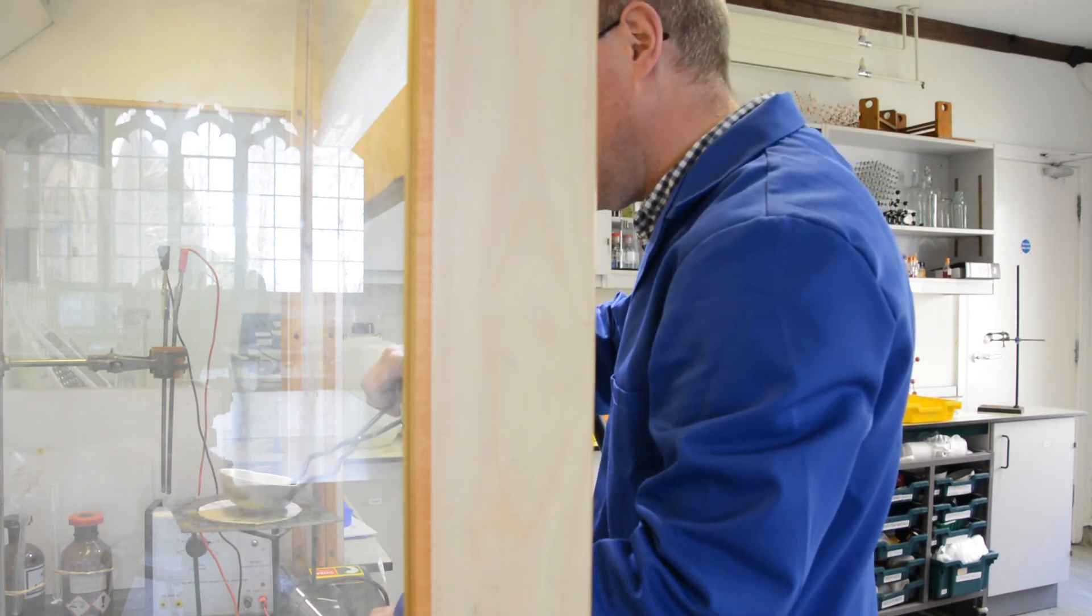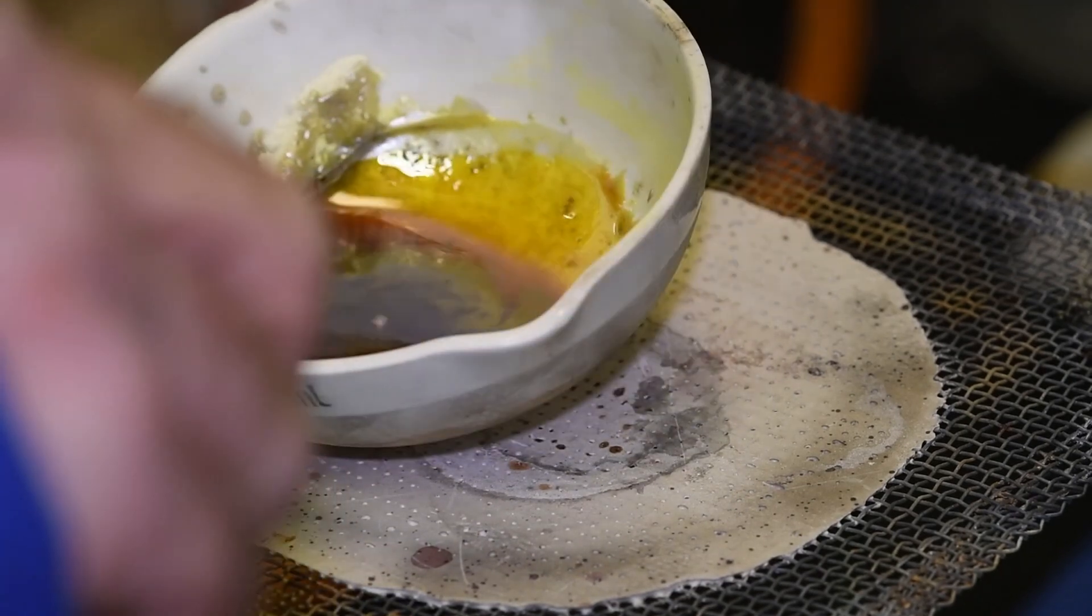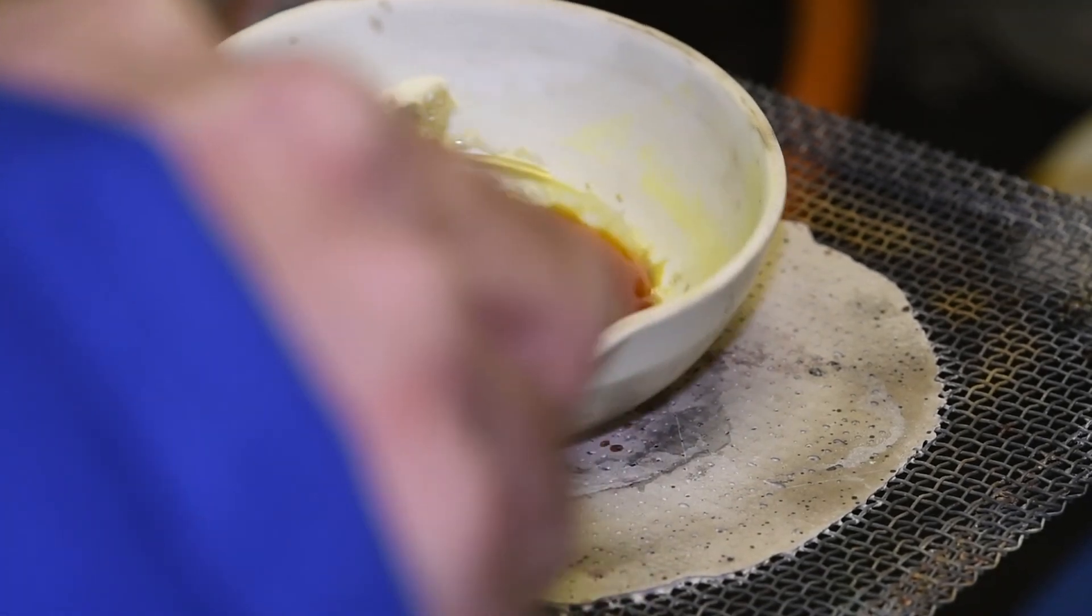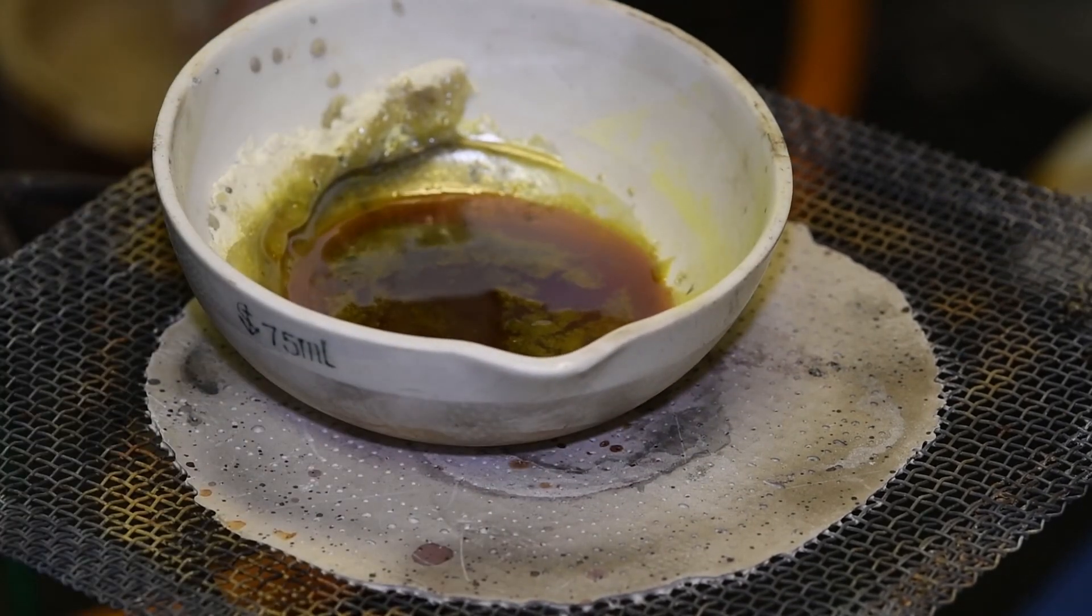I don't know whether we can see in there any evidence of lead. Certainly a bit of a metallic shine in there.